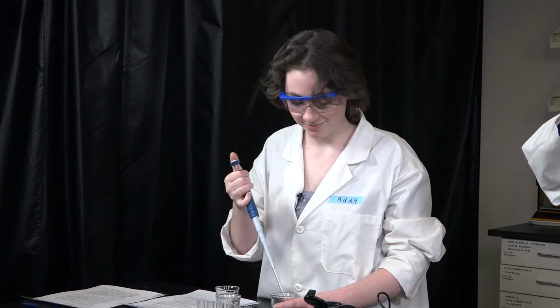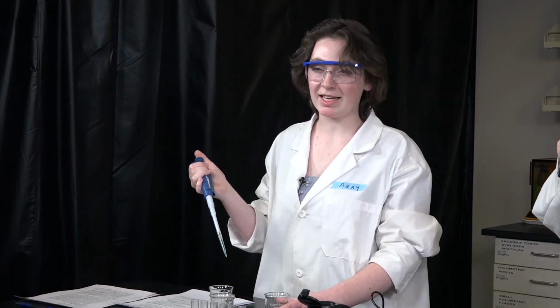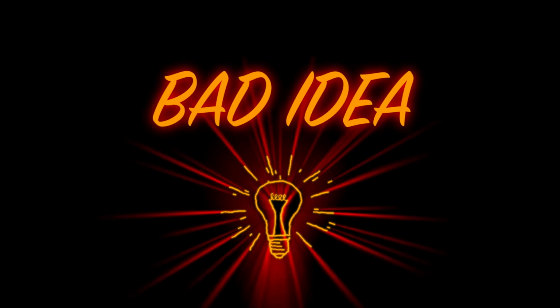Sorry this step is taking me so long, Addie. It's a little bit tricky. No worries. Lab doesn't get out until 4. We've got plenty of time. Oh, great, thank you.